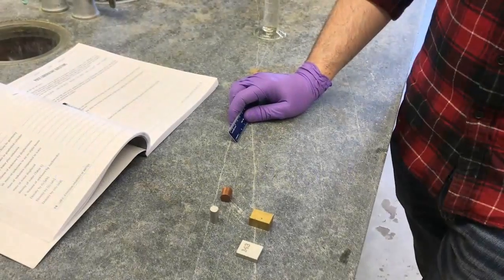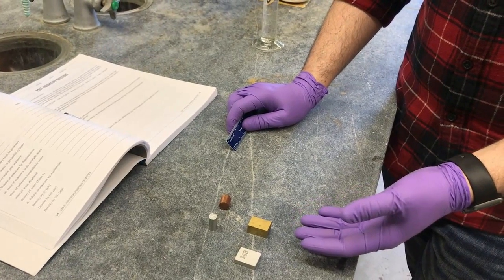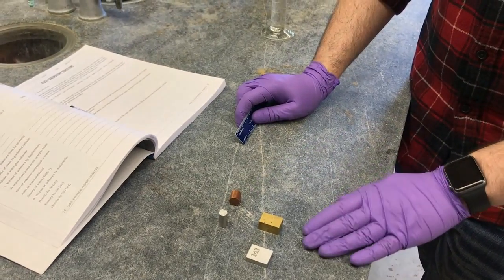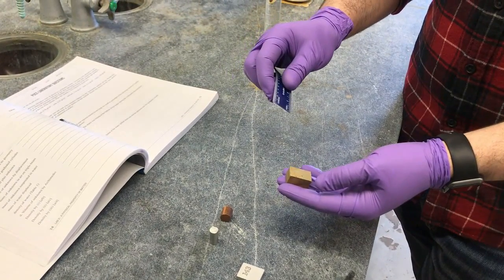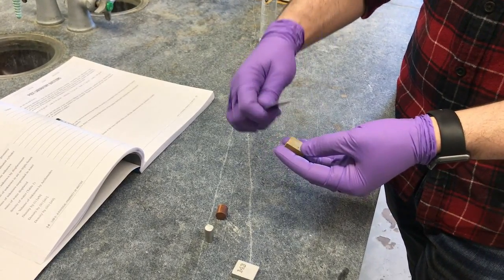For part 1 and for part 2 and 3, you're going to be using the same solid for each part. You can use a rectangular prism or you can use a cylinder. So I'm just going to choose one of the solids, and for part 1, or method 1, just record the physical dimensions, so the length, width, and the height.